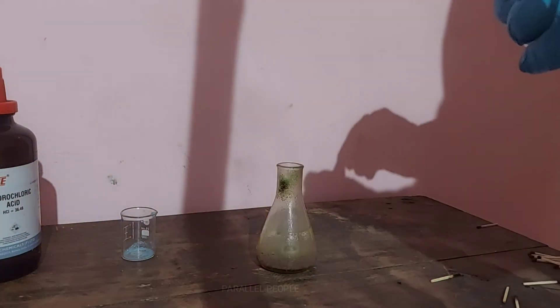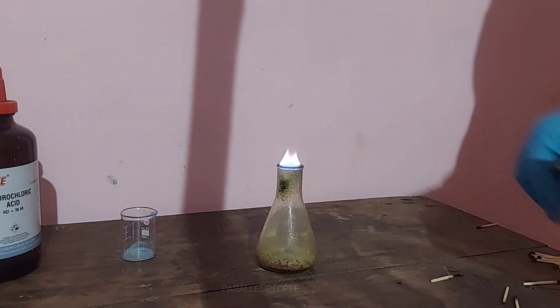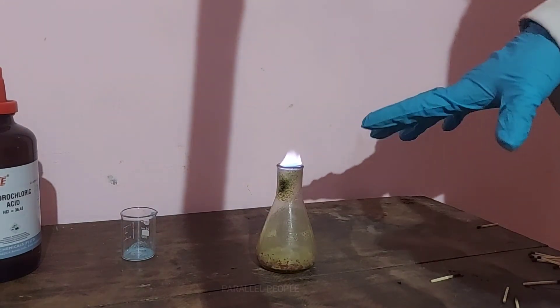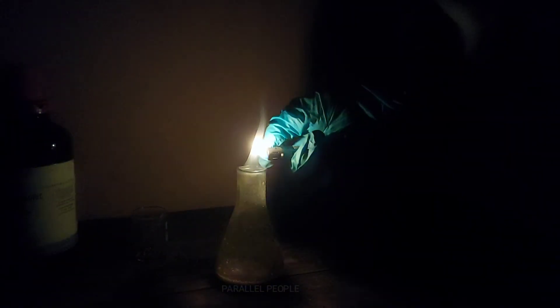This bright color of the flame is due to the excitation of electrons from the orbitals of copper — which is basic theoretical stuff you can study later in school or graduation level academics. You can see the beautiful blue colored flame that looks like it is dancing in the conical flask. That is the main thing we can see here.